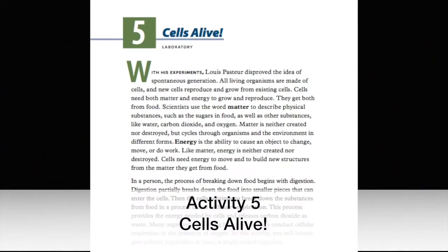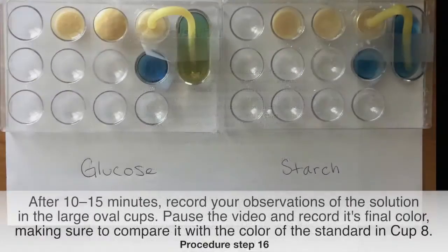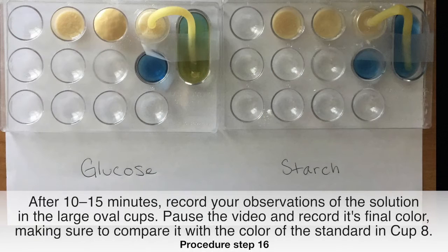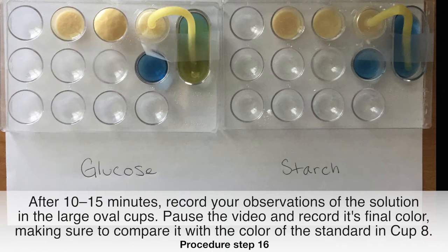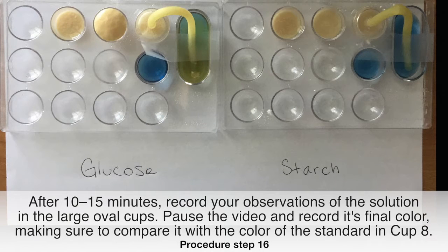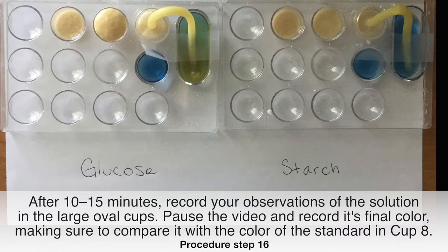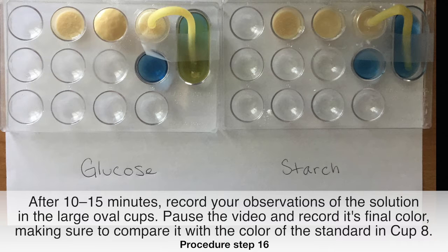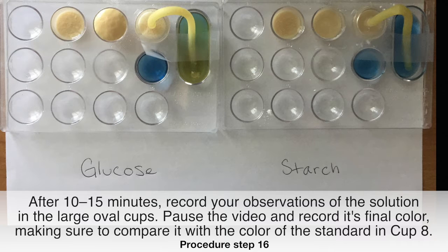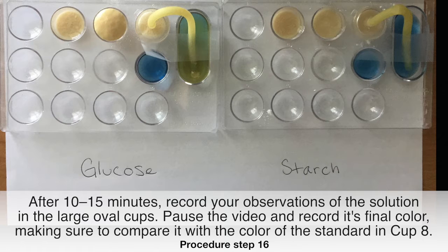Activity 5, Cells Alive. After 10 to 15 minutes, record your observations of the solution in the large oval cups. Pause the video and record its final color, making sure to compare it with the color of the standard in cup 8.